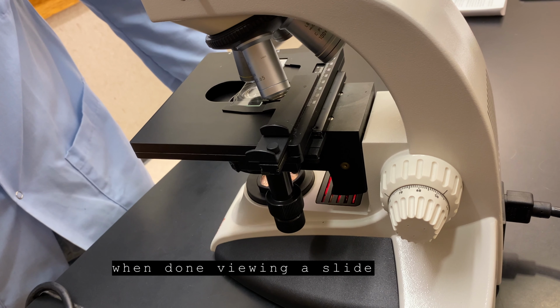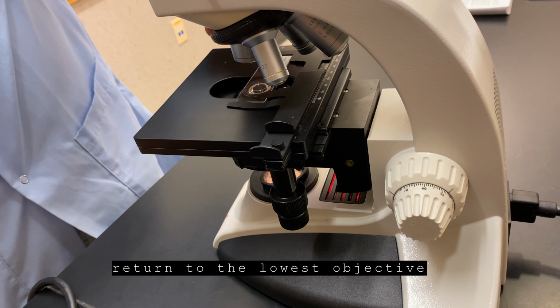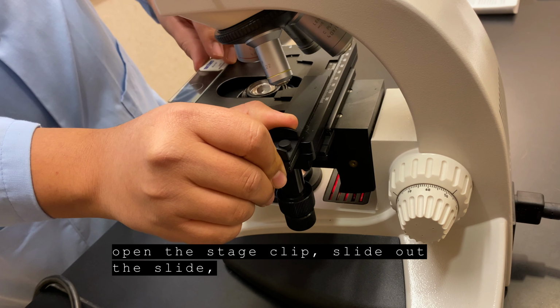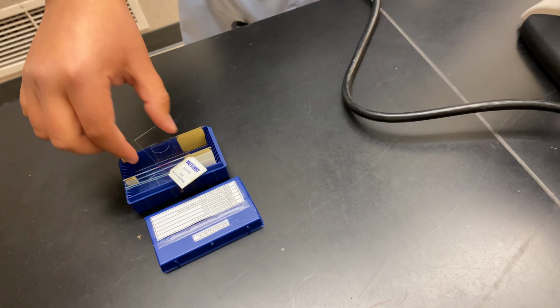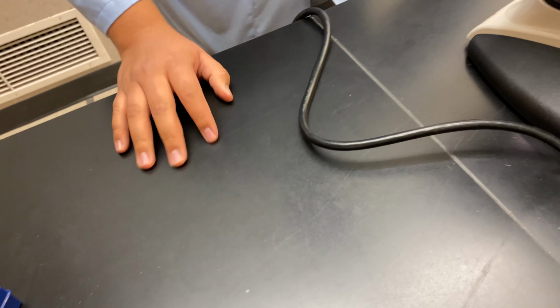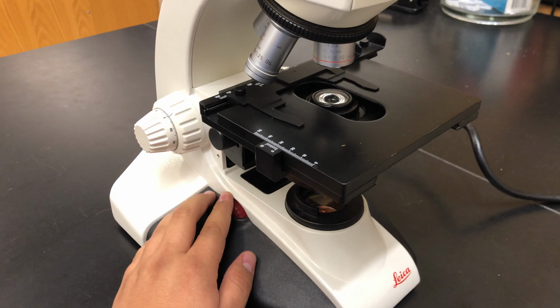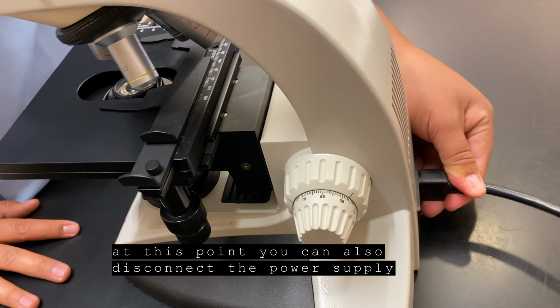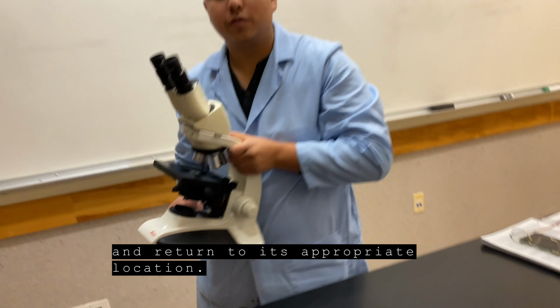When done viewing a slide, return to the lowest objective, open the stage clip, slide out the slide, and you may turn off the power. At this point, you can also disconnect the power supply and return to its appropriate location.